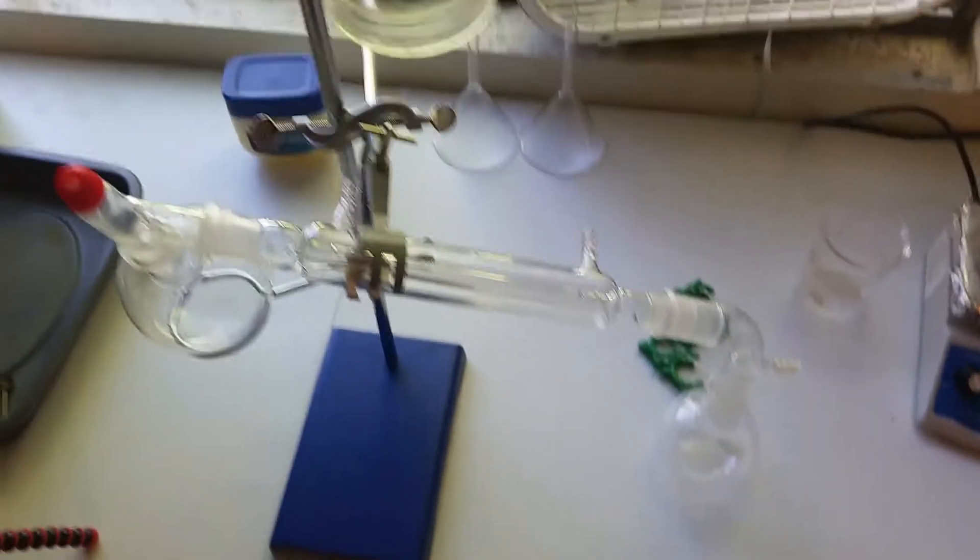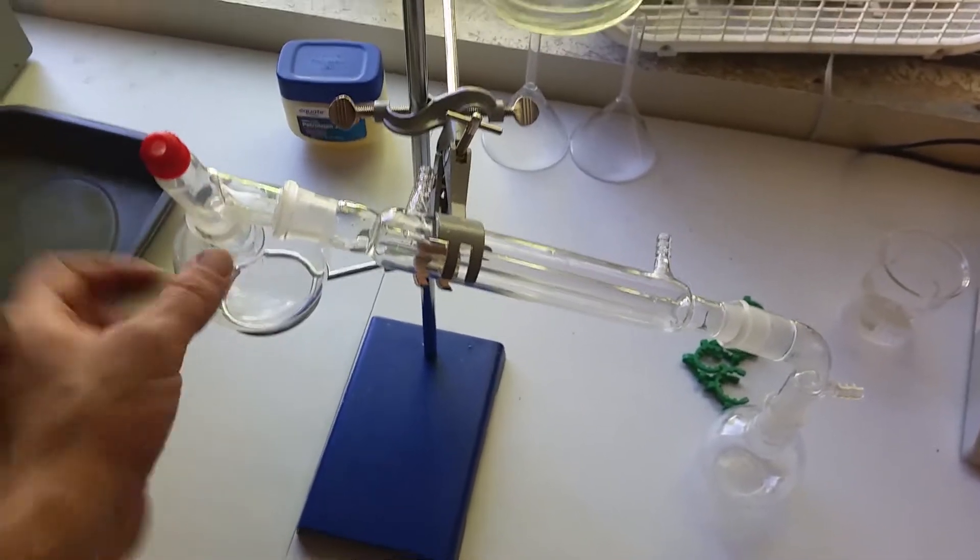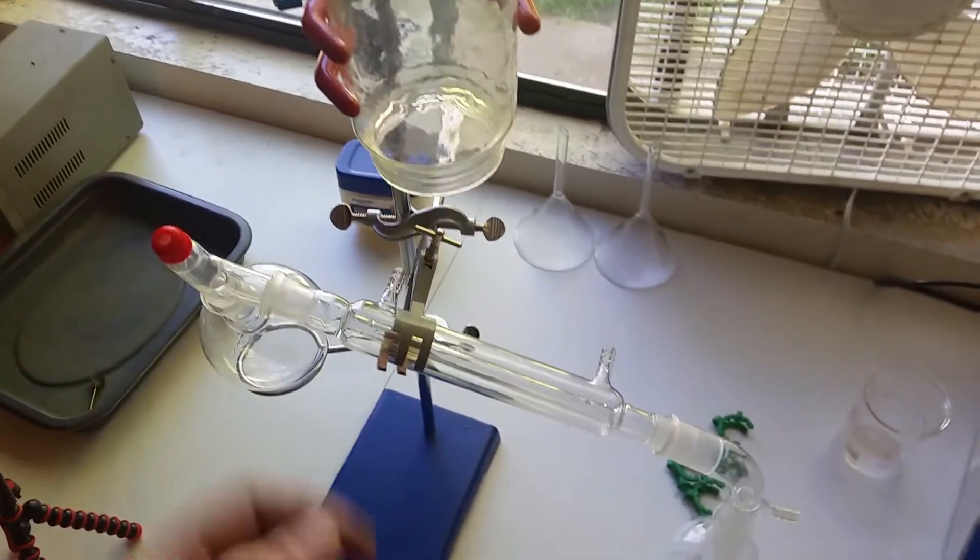I've not actually done this reaction yet. So what I'm going to do is get all these joints greased up and get this tube connected and we'll get this reaction started.